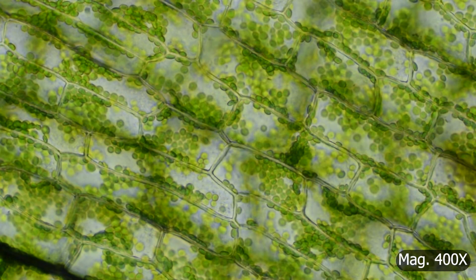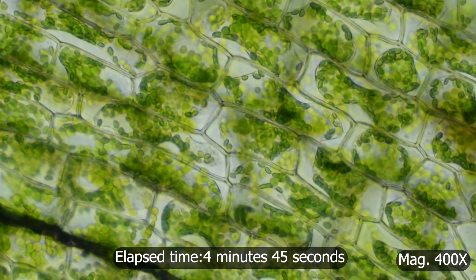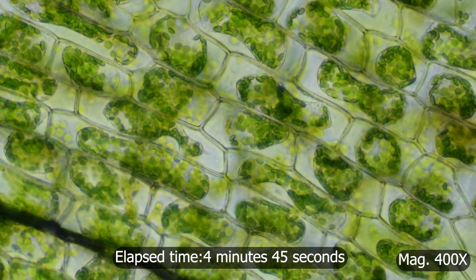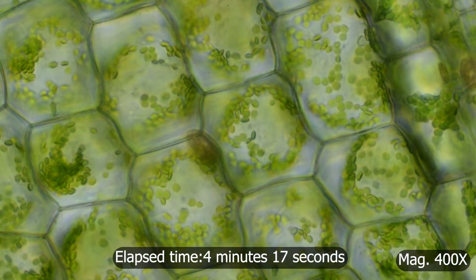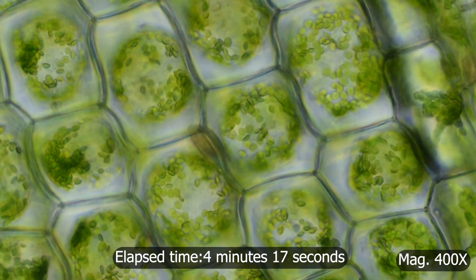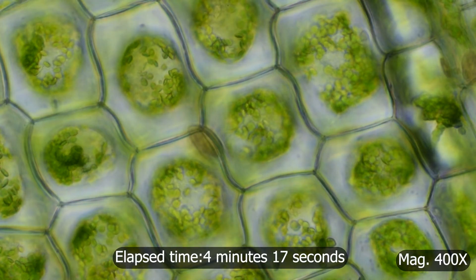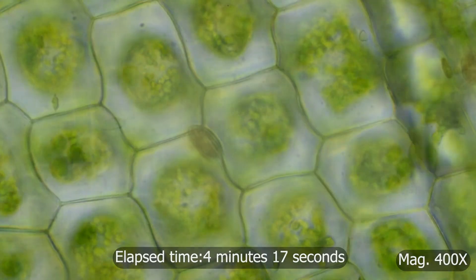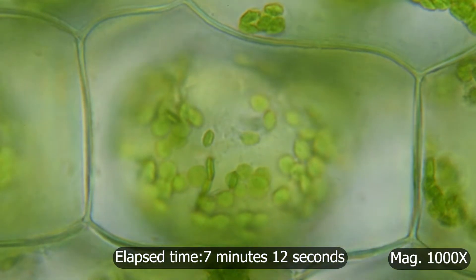When these cells are placed in a salt solution, osmosis takes place, which is the diffusion of water. Water moves down its concentration gradient from an area that has a high concentration of water to an area that has a low concentration of water. As a result, the cell shrinks as it loses water. This process is called plasmolysis.